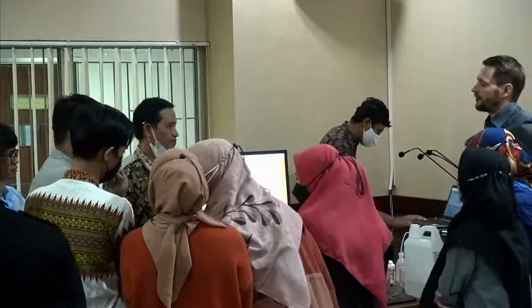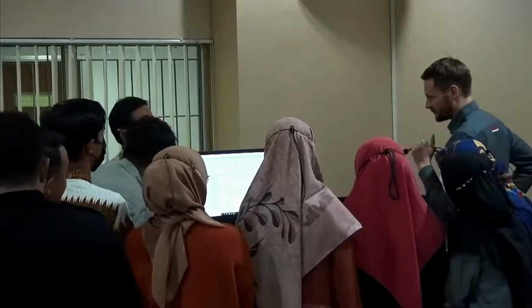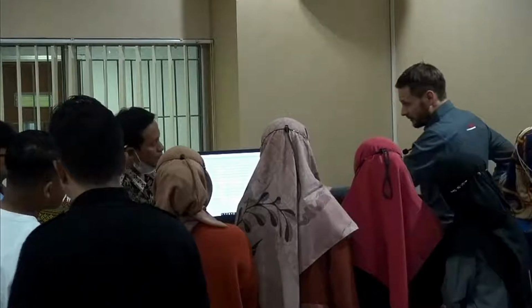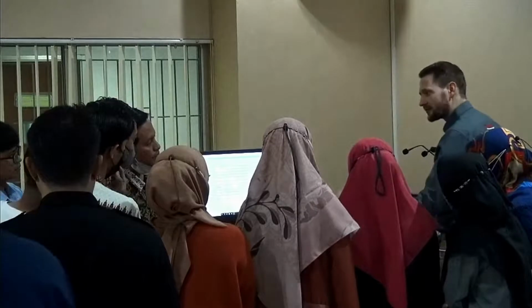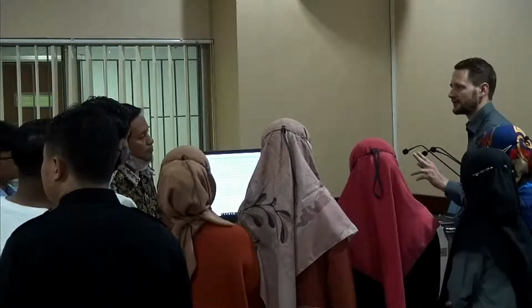This is now a very, very critical thing, and I have to remind me if I forget it at any point on the next unit, or the next group of people. So we were lucky here that this was in the database, or also we can find this in literature. You have to be very careful. I know a couple of manufacturers, and I've come across this a couple of times. They tell the customer that they can determine the refractive index. And that, sorry, but that cannot be true.